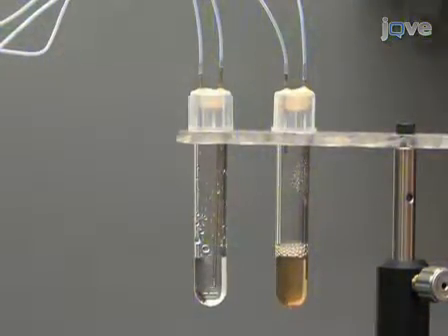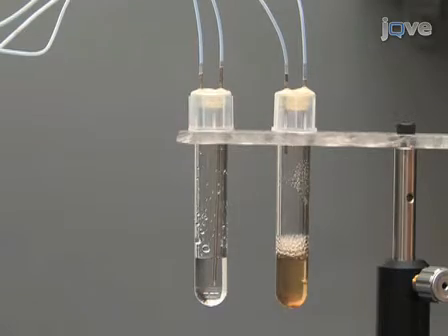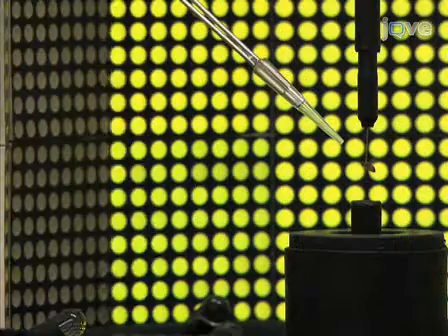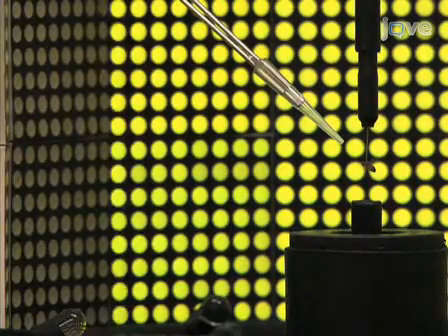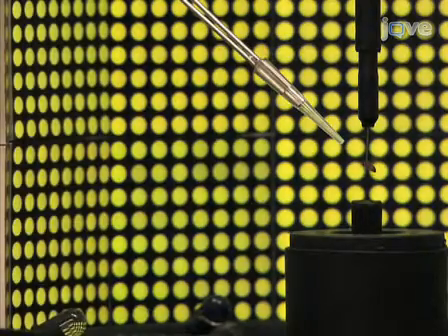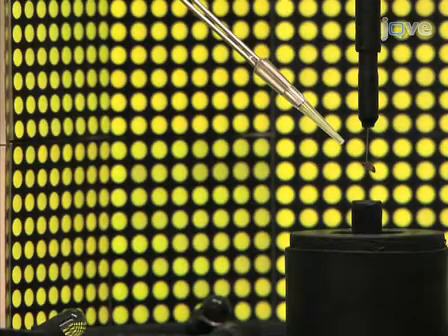Before each condition, turn on the experimental odor, either water or vinegar, and visually drag the fly into the plume by oscillating a small vertical stripe at the position of the plume. Now that the fly is oriented toward the plume, remove the oscillating stripe.